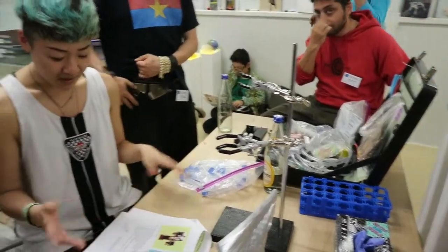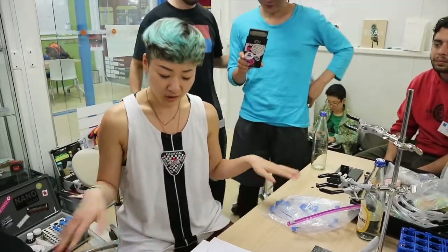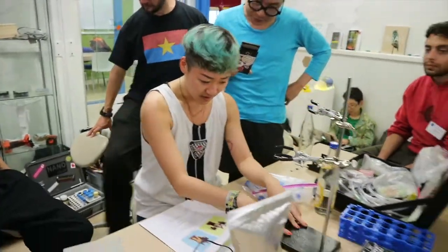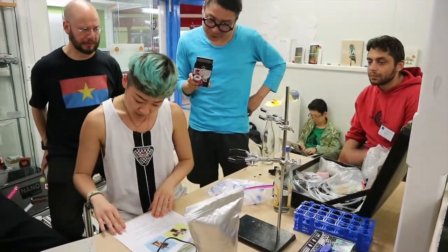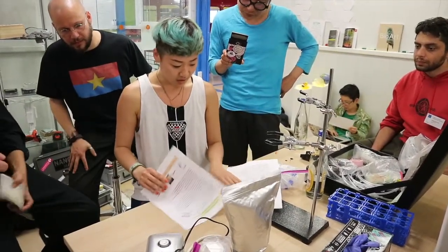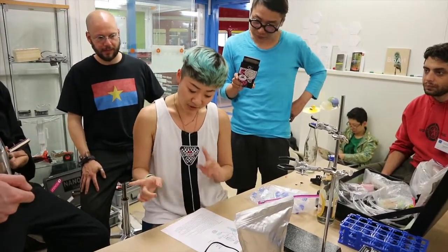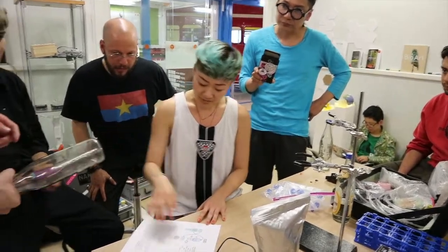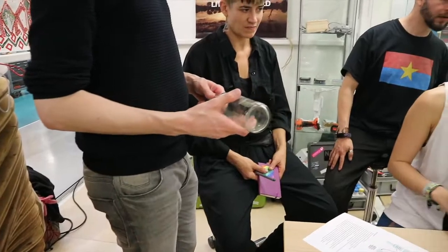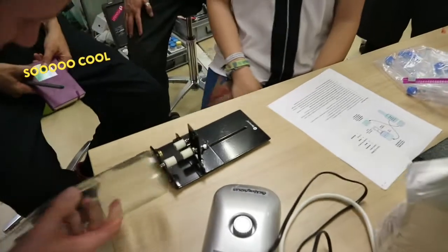But it works fine. This DIY construction uses these angle brackets — really easy to find hardware — and some metal rods and zip ties. But this is the lab version. So we're going to skip the column construction and go straight to the urine extraction. But first we have to hack this bottle. We're just going to cut the top off of it using this bottle cutter. It's so cool.